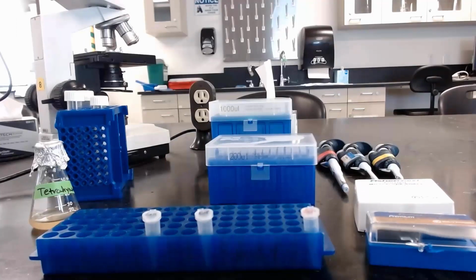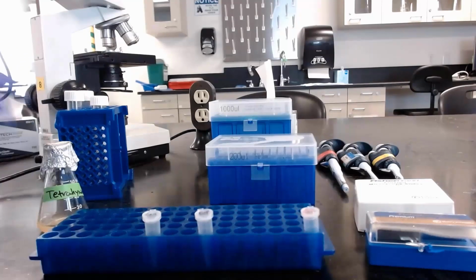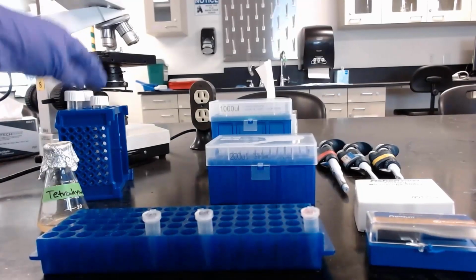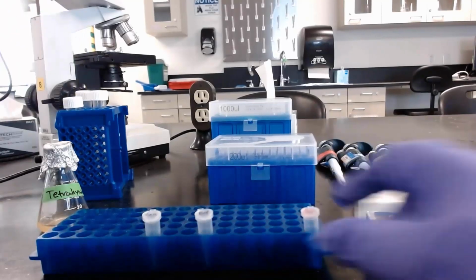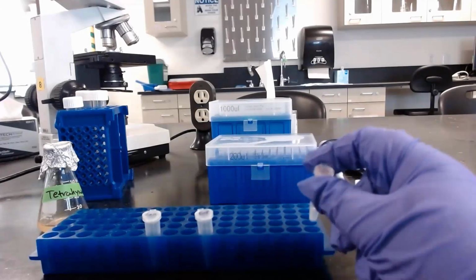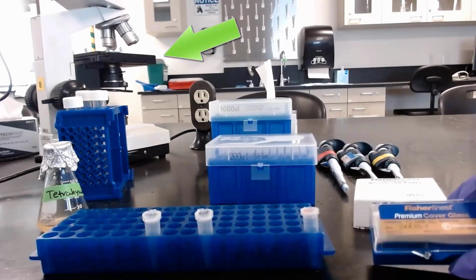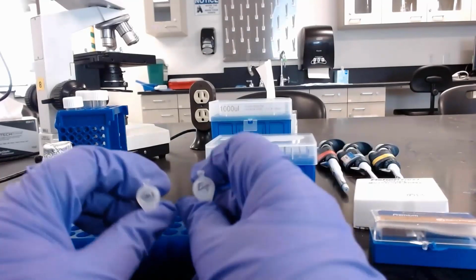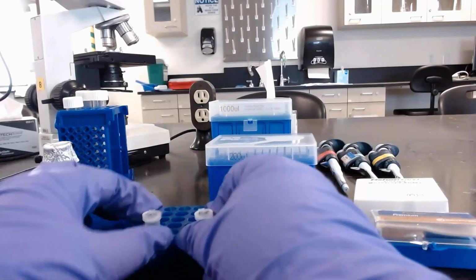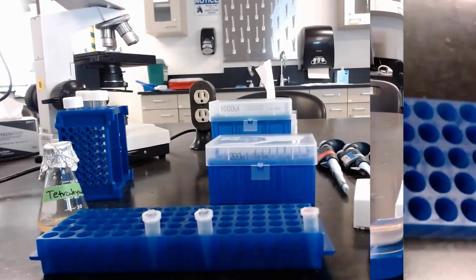Back in the lab, I've collected all the materials we'll need: our Tetrahymena cells, some extra media, glycerol, India ink, and glutaraldehyde, which I'll explain the purpose for later, a compound microscope, along with slides and cover slips to let us view the Tetrahymena, some microfuge tubes, one labeled for the control treatment and one for the experimental, micropipettes and tips for transferring liquids, and a timer, which in this case is my phone off screen.